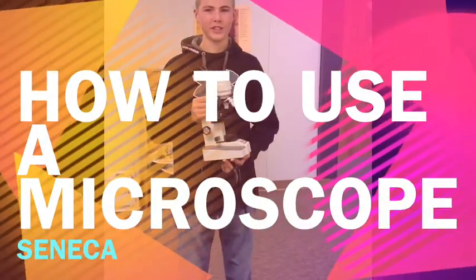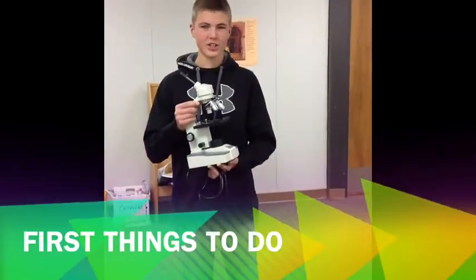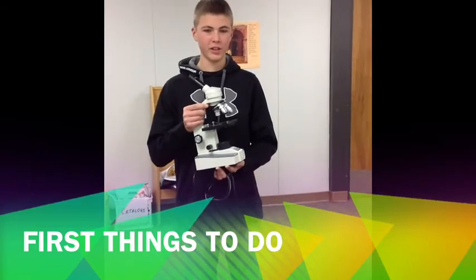I'm going to tell you how to use a microscope today. When carrying it, always make sure you're holding the neck and the base securely.